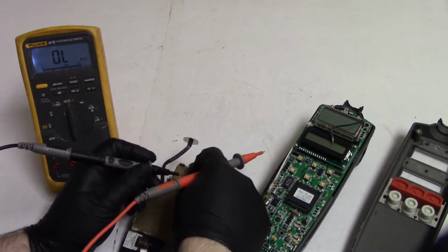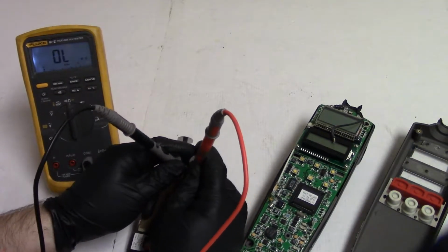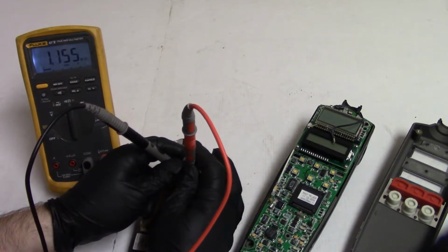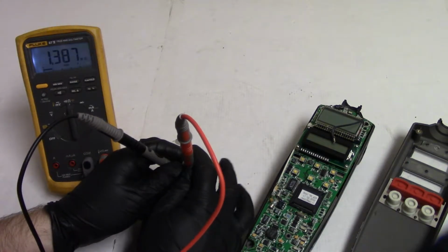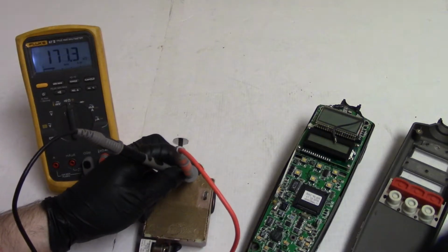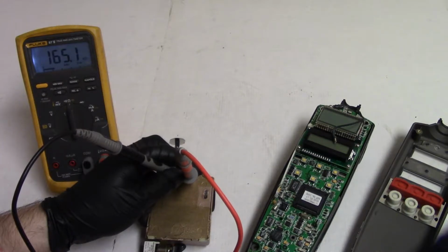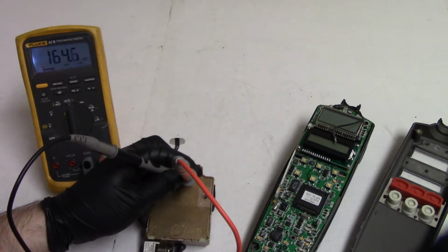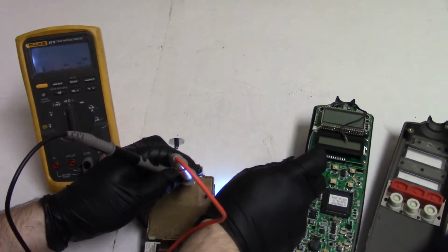Let's see if this sensor is anything. So we're getting nothing. Wait a minute, there we go. So about a meg. And does it change if I cut the light off? Oh yeah. So that's probably a light sensor. Where's my flashlight? Let's really exploit that and see if that's the case. I think that sensor in the bottom is to tell it when the UV light source is on. So let's hit it with some visible light and see what it does.